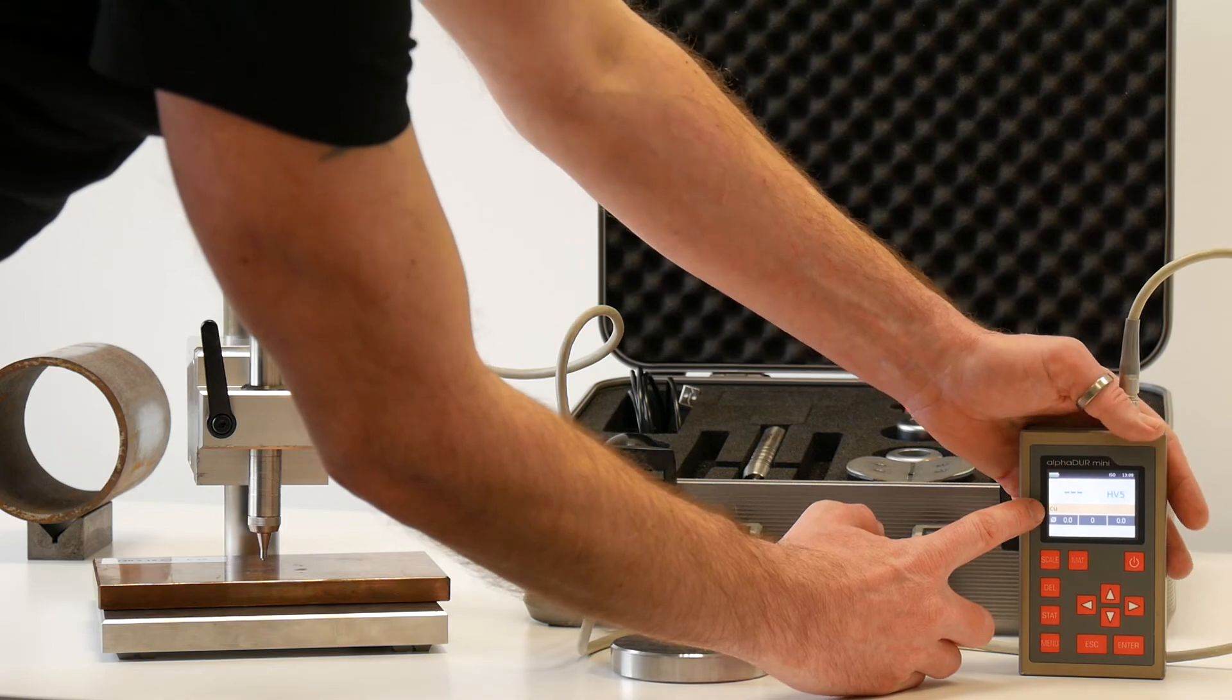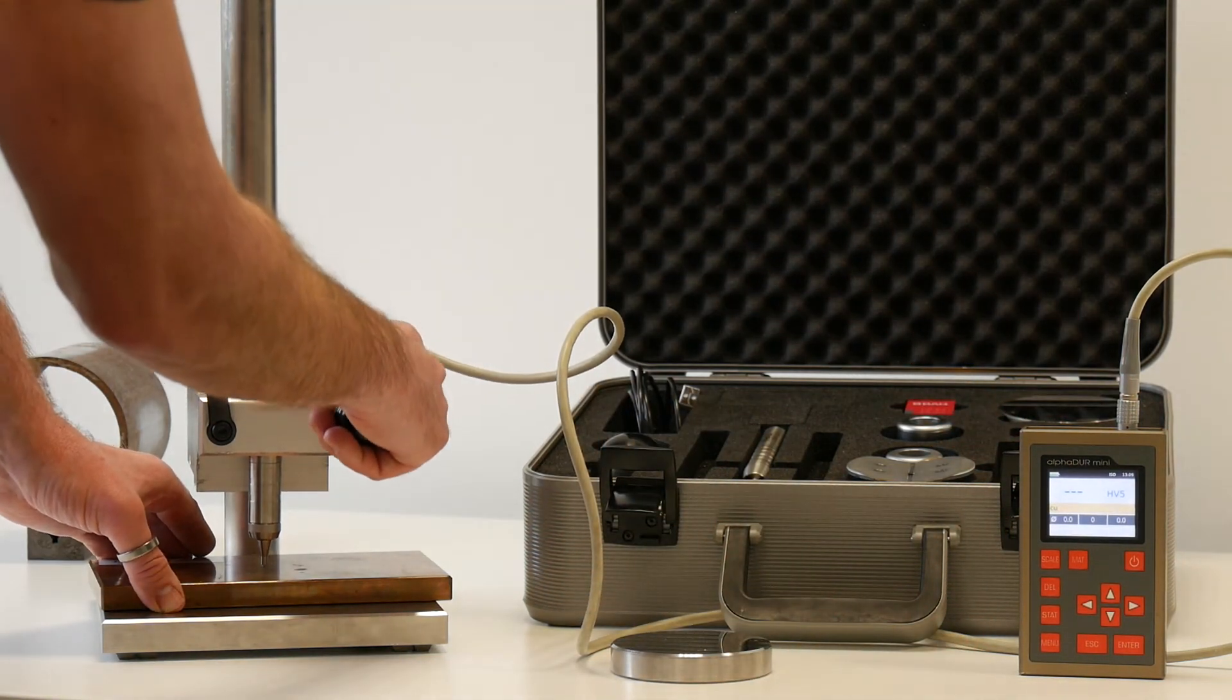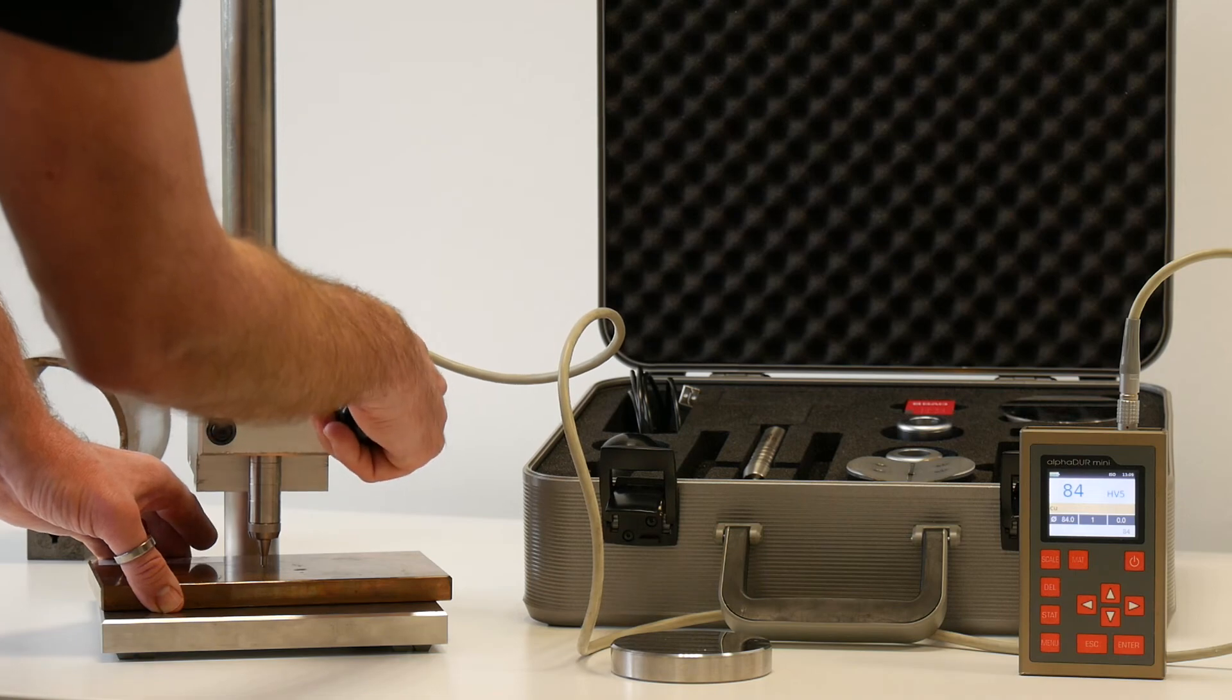Now you can see our new material calibration on the display. And the readings are perfect.